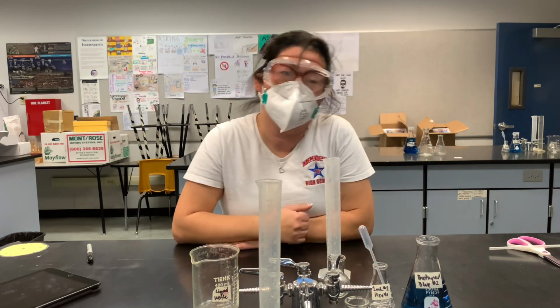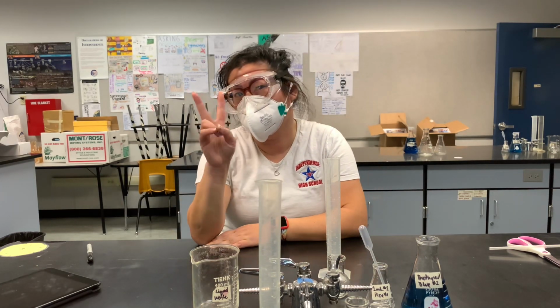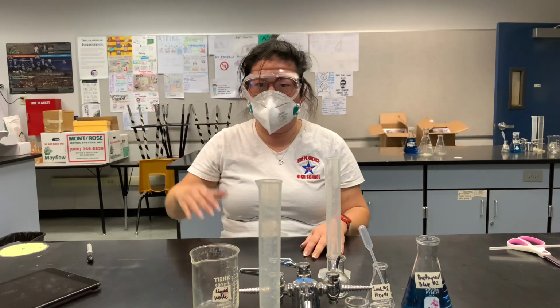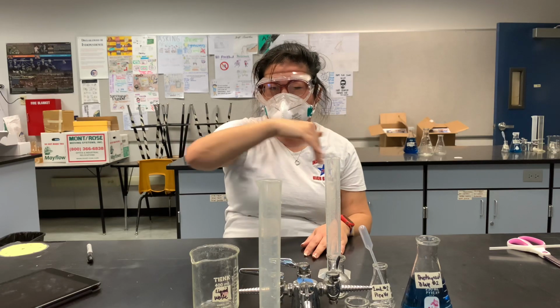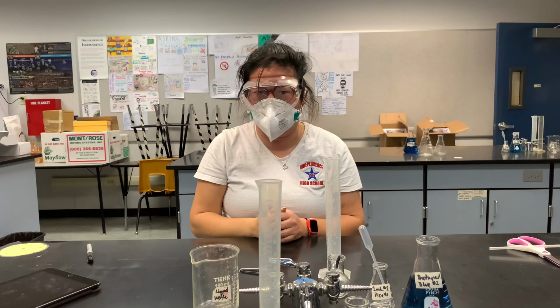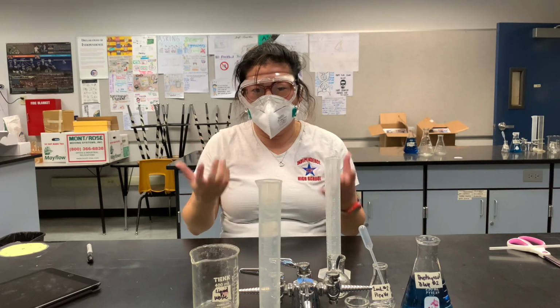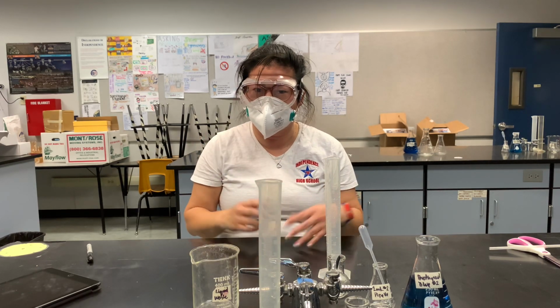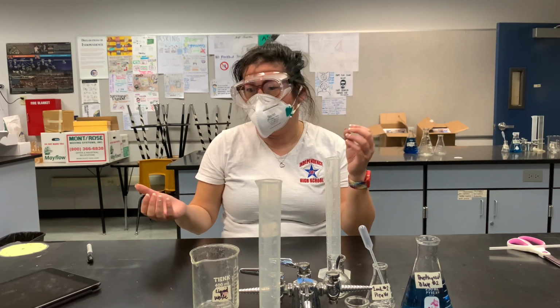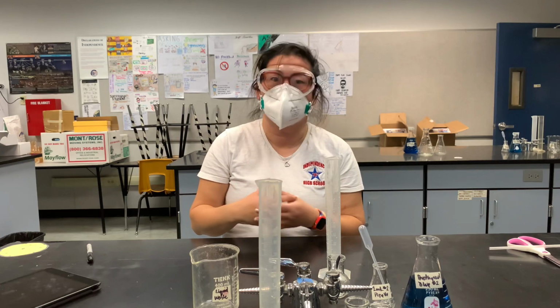We noticed when we played the carbon cycle game, there were two areas in which carbon traveled between the atmosphere and the surface ocean. So in the atmosphere it's carbon dioxide, but when it goes into the water it becomes carbonic acid, which is a weak acid. And we're going to see how the pH changes and how eventually that pH does affect the living things that are living in the ocean.